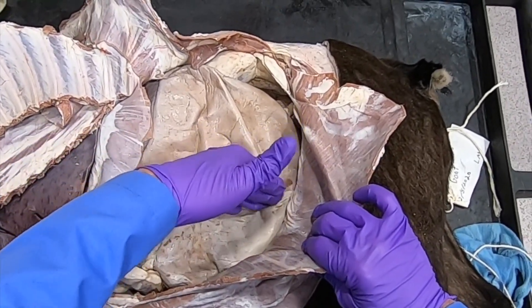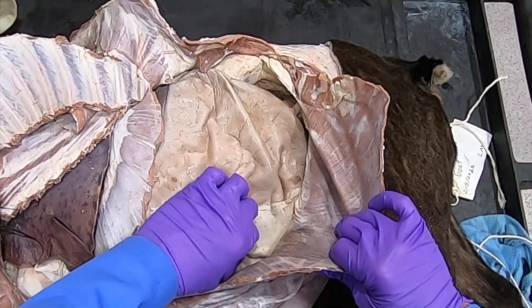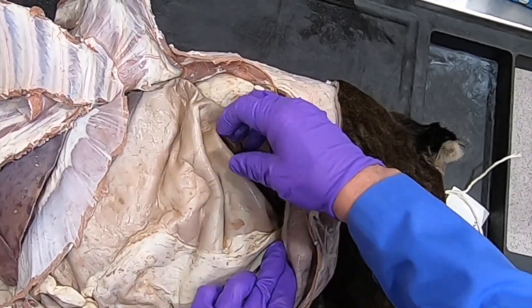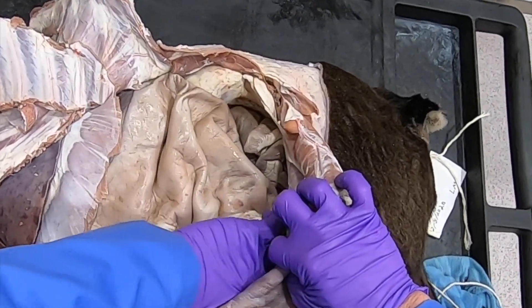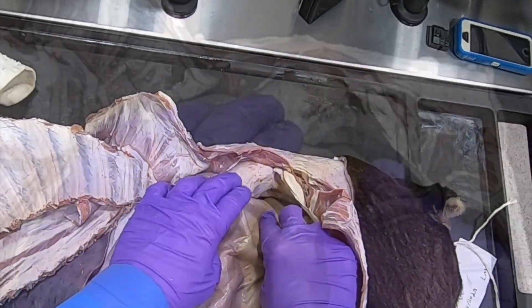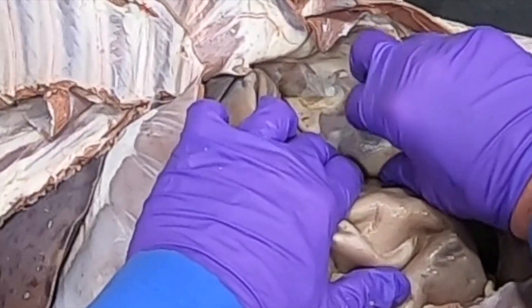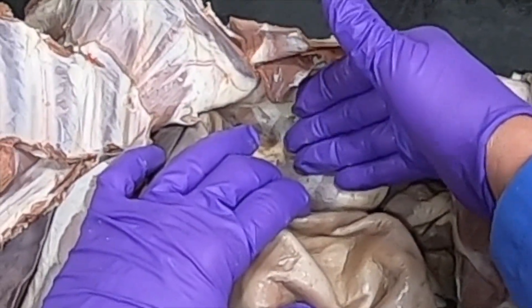Along the left longitudinal groove of the rumen, the superficial leaf of the greater omentum attaches. In the goat, the dorsal caudal blind sac is not as prominent, though the ventral is still very prominent and is covered by the superficial leaf of the greater omentum. Up here we can also see the kidney — in the ruminant on the left side it dangles, which allows it to be pushed to the right when the rumen fills.